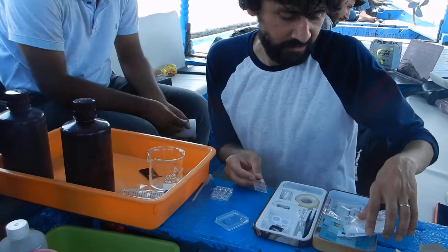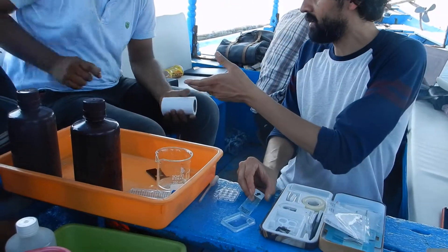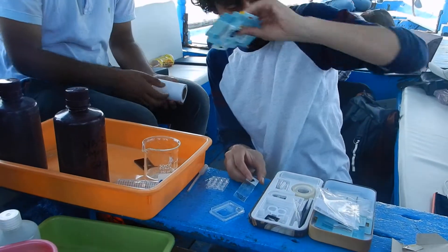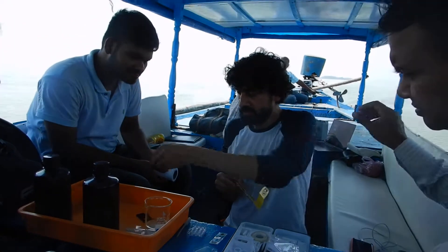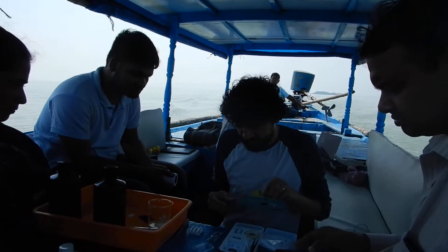Because when you add nail polish, you are modifying. When you add chemicals, it modifies and sometimes kills.